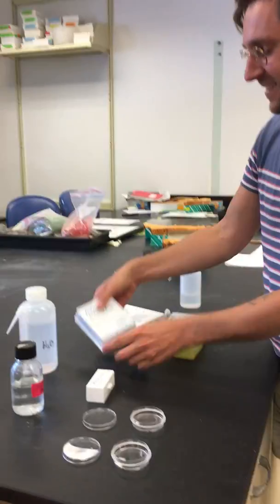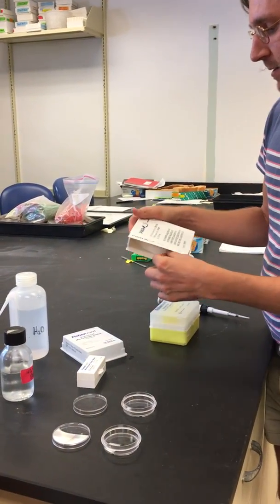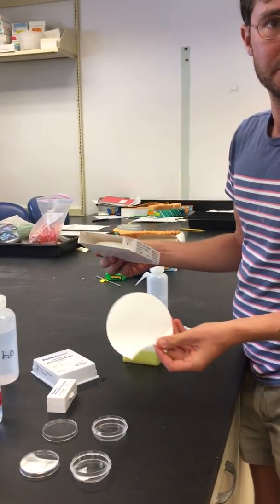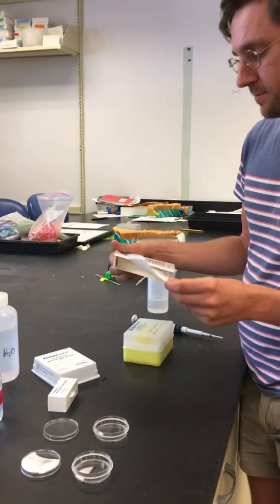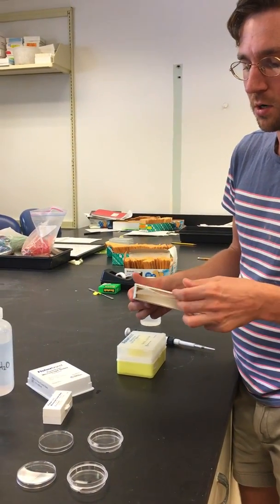Hi Sarah. Microscope slides, filter paper. This is giant because I screwed up the order. It doesn't have to be this big. You could use filter paper, tissue, or a paper towel.